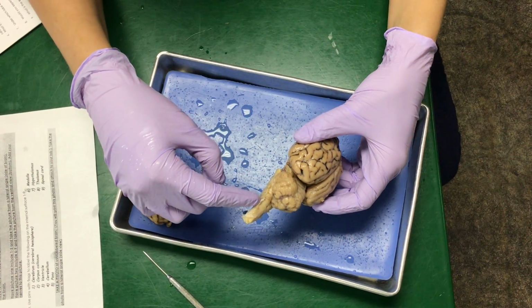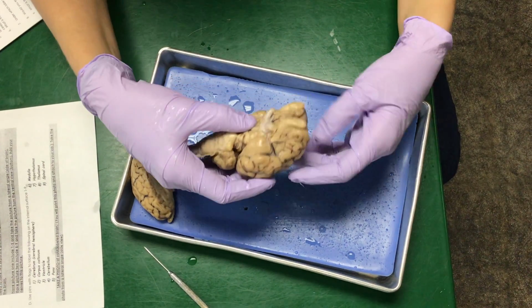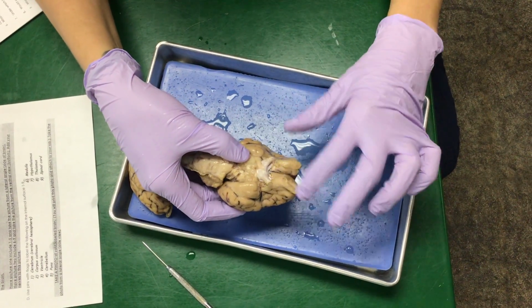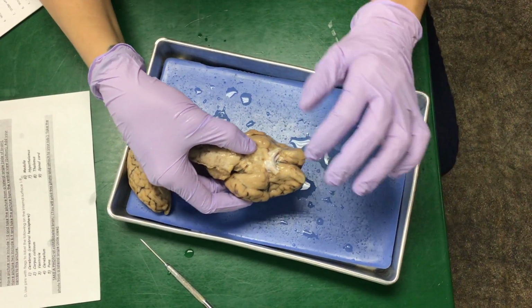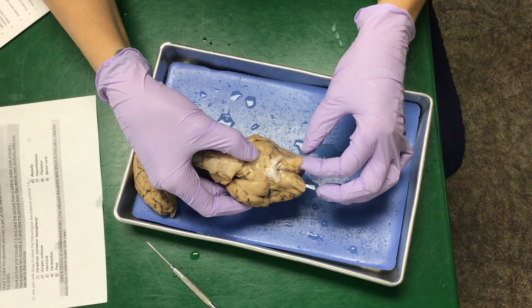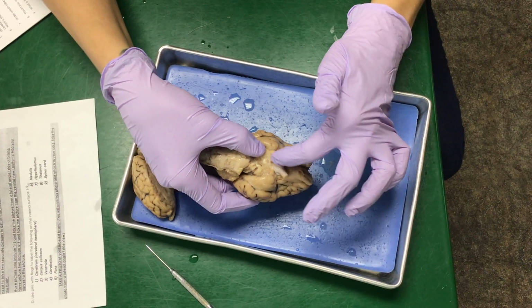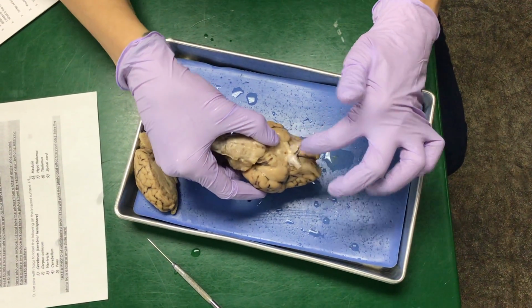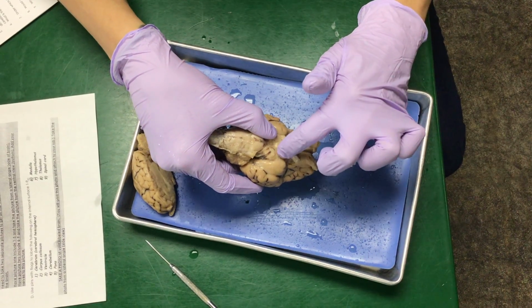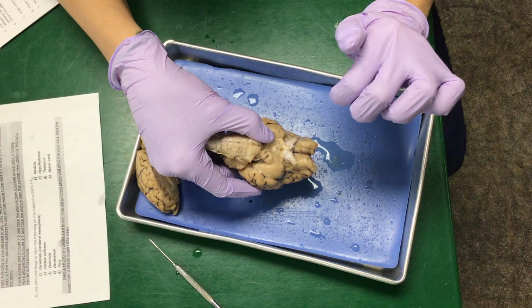When we're looking at this brain, also other things that you need to label that you probably haven't seen yet on here are some of the cranial nerves. It talks about that on the front of the lab, but one thing you have to do is olfactory bulbs, which are these things on the top, and then the optic chiasm, which is this, it looks like an X right here, that optic chiasm that we're gonna see on there.